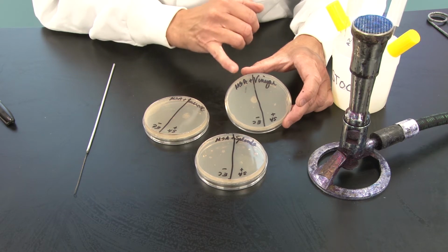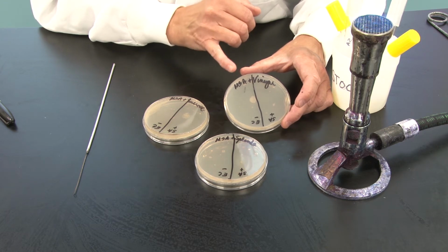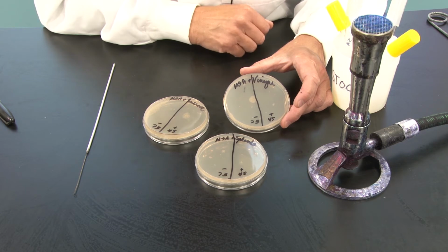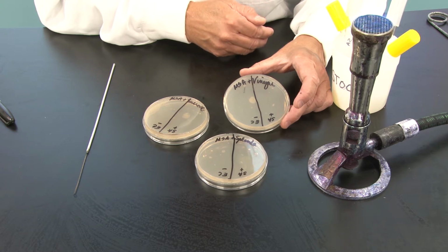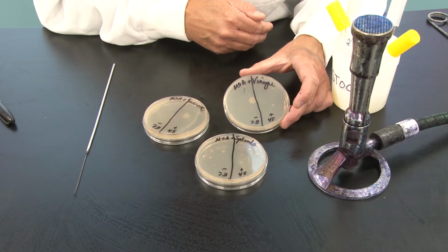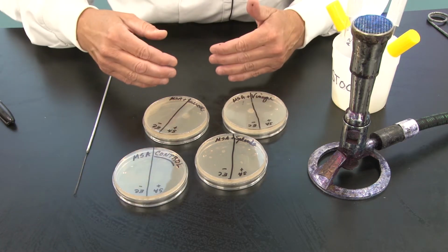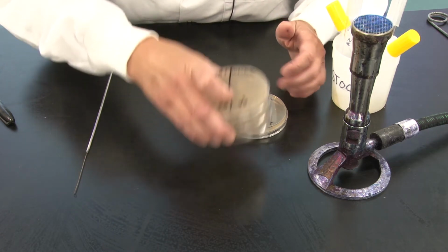So we'll see if some can use acetic acid, and even if some can, is this too high of a concentration of acetic acid for bacteria? One of the things we're going to have to consider as far as growth factors that control bacterial growth is pH. We'll look at that later. For now, we've got our carbon source plates inoculated. We are going to place them in the incubator at 37 degrees.